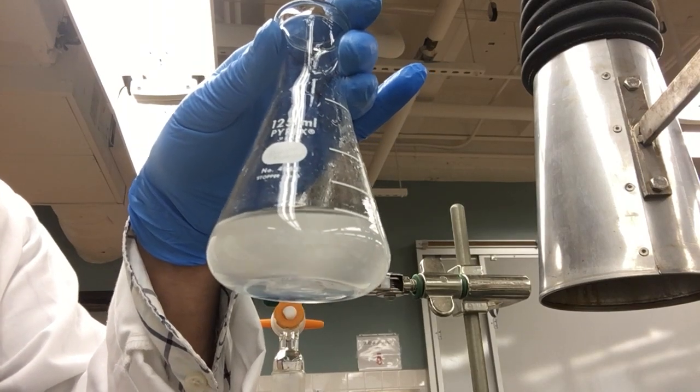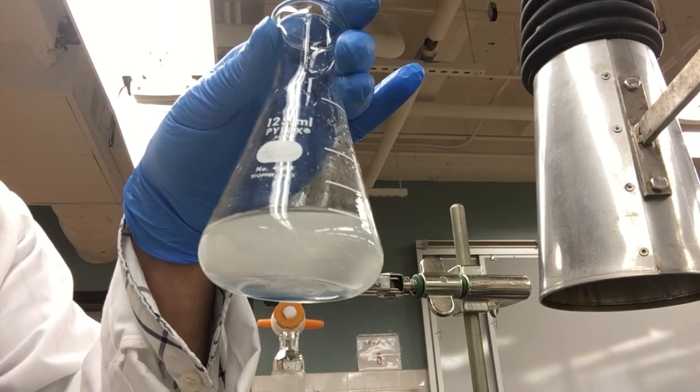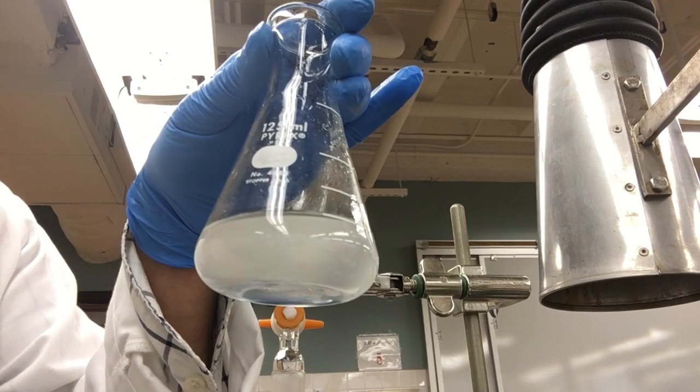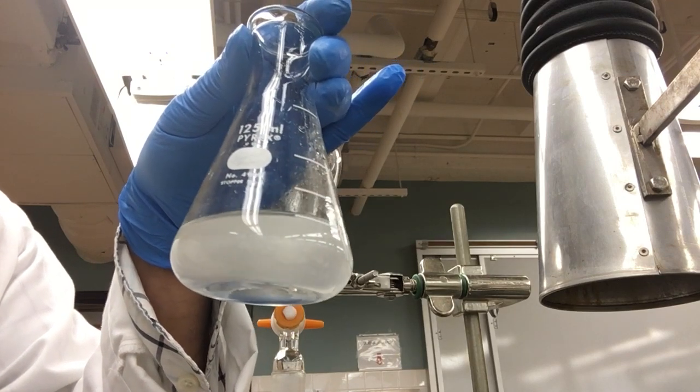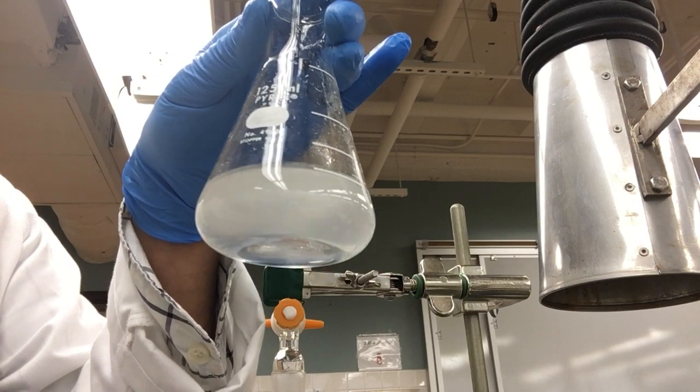So here is our mixture once again. However, salt was added in order to salt out any hexanol 1 or 2 that was still dissolved in water.